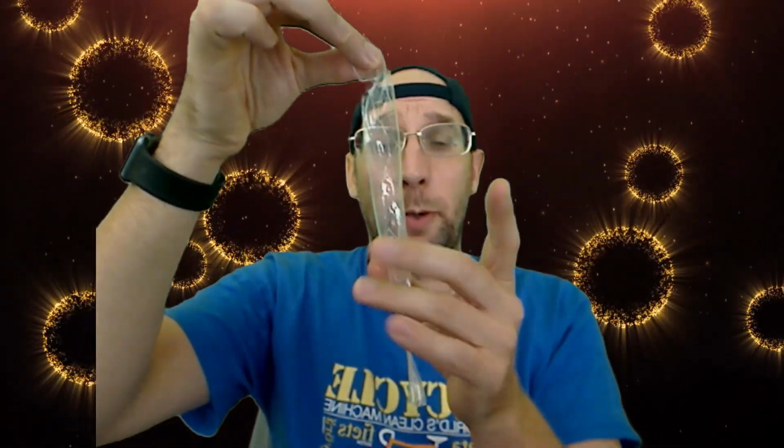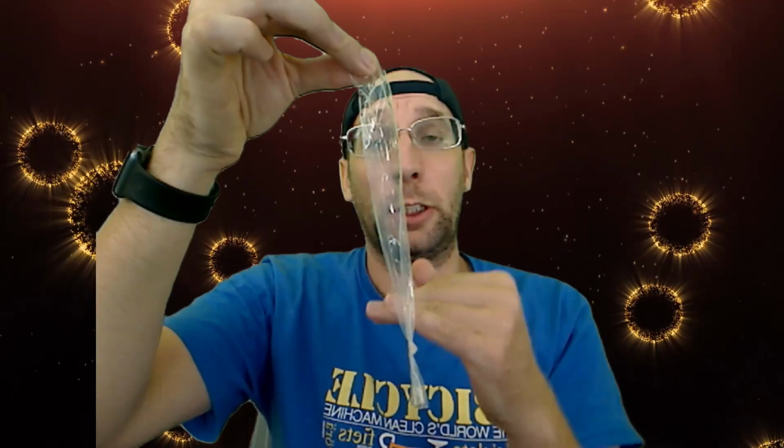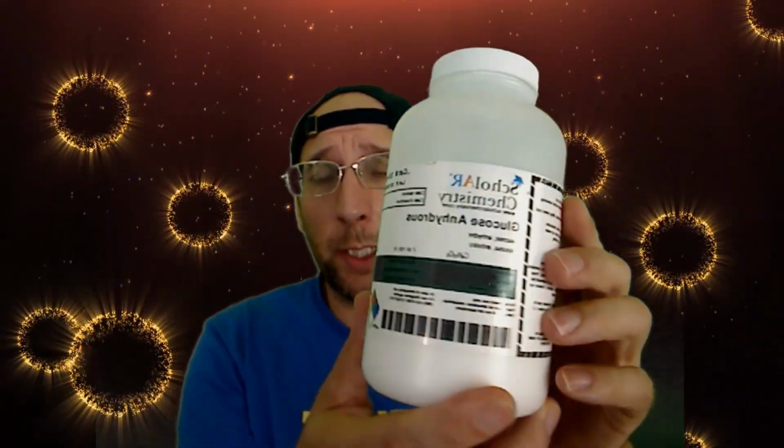We're going to put different solutions in this cell, and we're going to see what can pass from the inside to the outside, or what can actually go into the cell as well. So we're going to see how the semi-permeable membrane is actually semi-permeable. So we're going to make a few different solutions today, all 10%. And there's some choice that I'm going to do with some of these solutions. So I'm going to show you everything that I have the ability to make, and then we'll see what we actually make of it. I have, for instance, glucose, like a glucose solution.